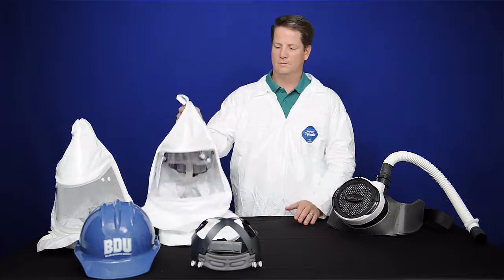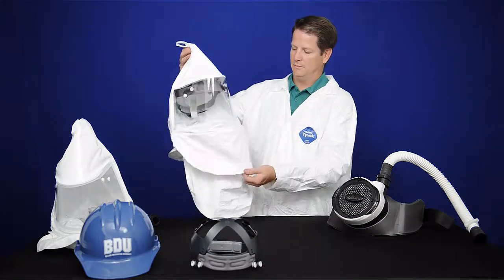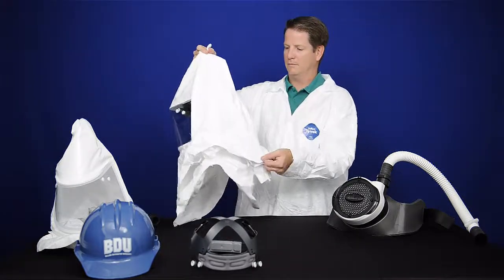First, perform a visual inspection on the hood and install the suspension or hardhat as appropriate.